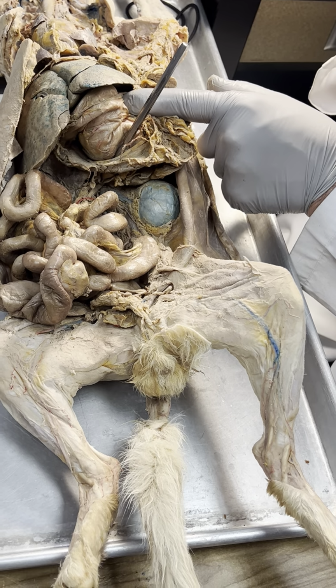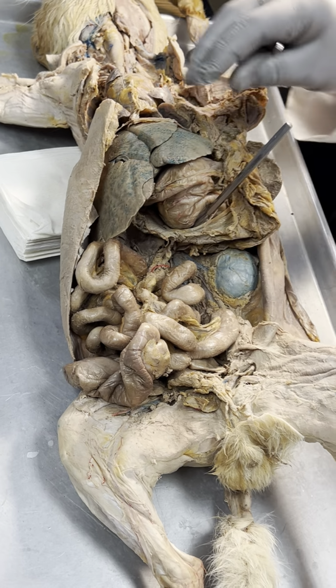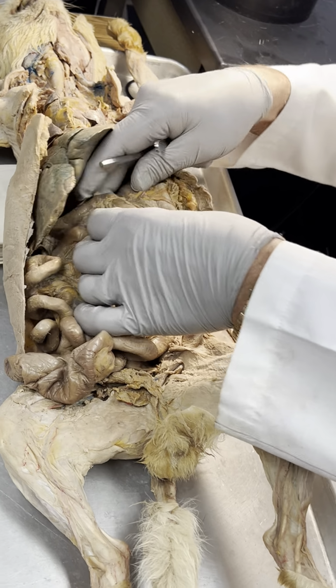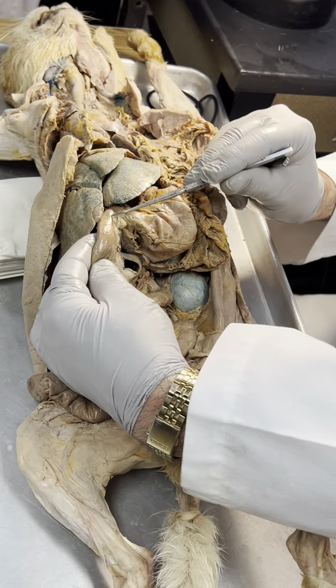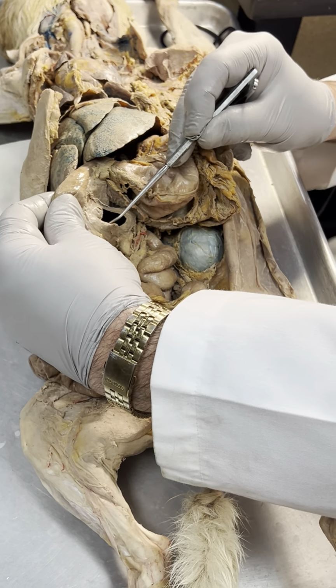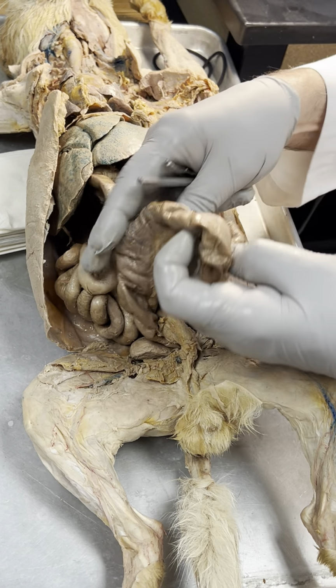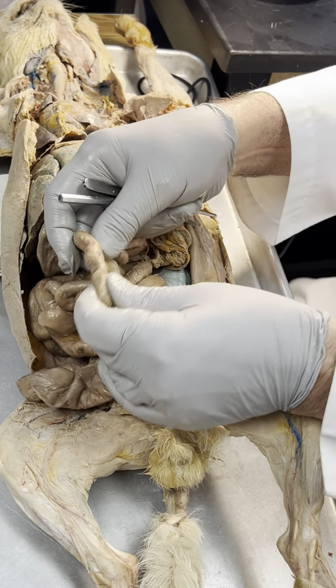So this time you guys get the benefit. You guys can't see it. How's it feel? Big kidney. Duodenum. Mesoduodenum. Trying to find a nice representation.